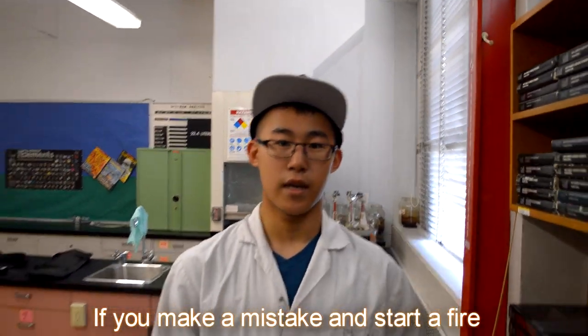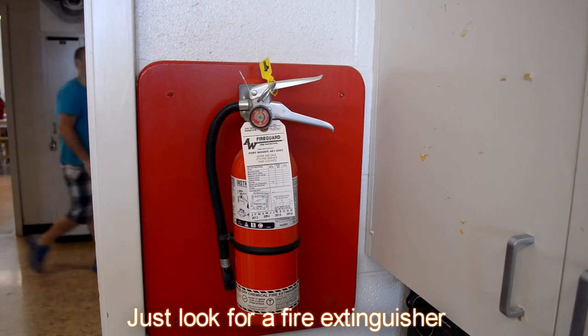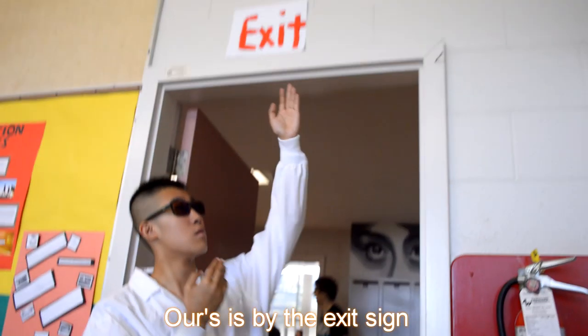If you make a mistake and start a fire, don't panic, you'll be fine. Just look for a fire extinguisher, ours is by the exit sign?